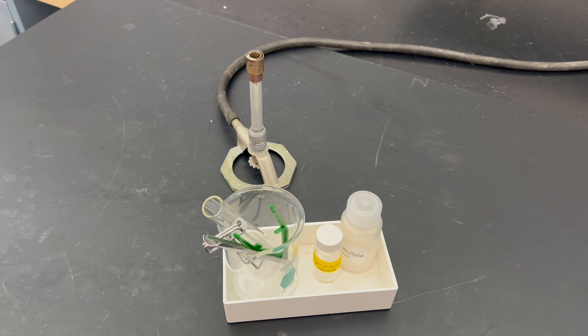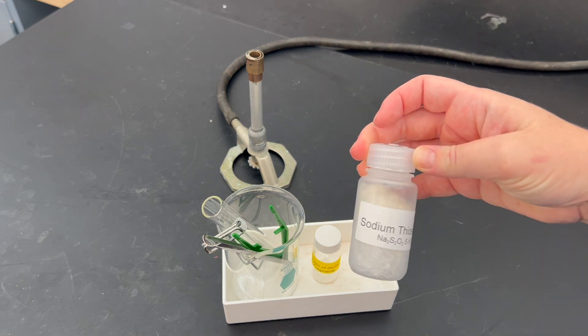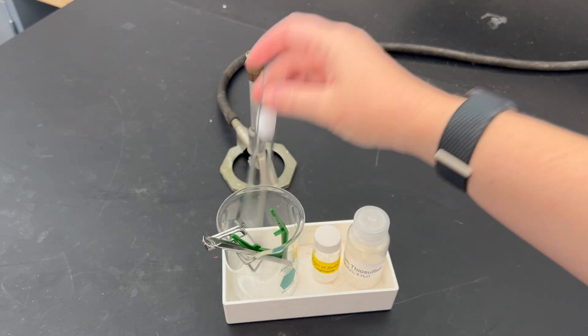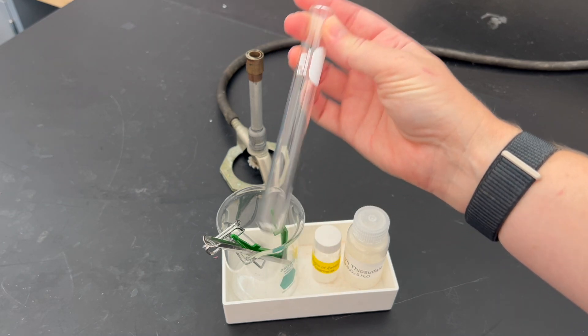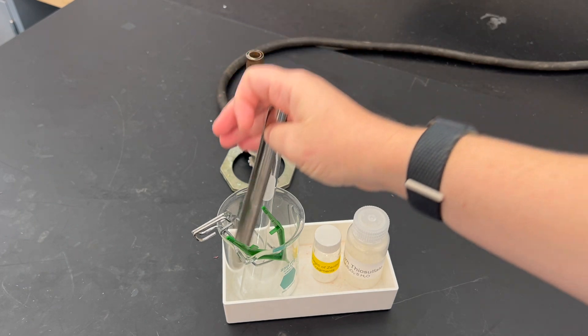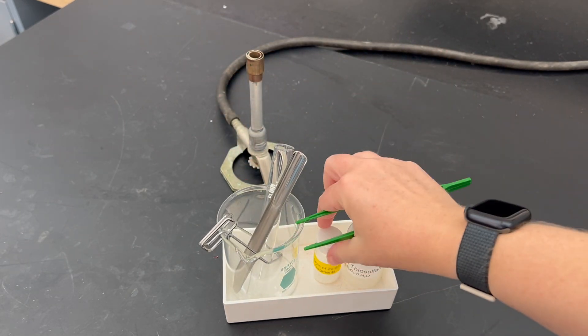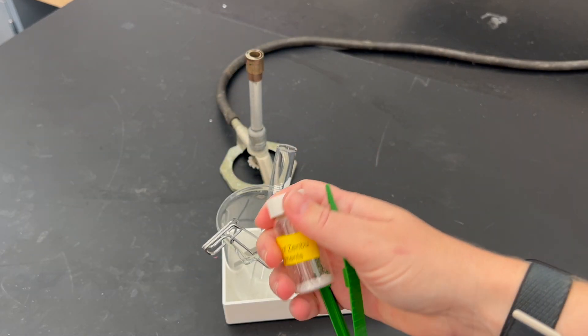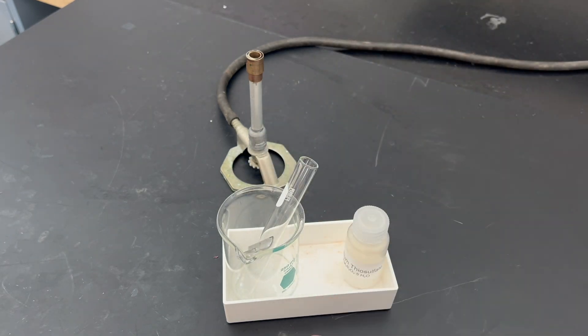Here's the kit you're going to need to do this lab today: sodium thiosulfate, a large non-disposable test tube, a metal scoop to get the salt out, some forceps, the magic of zenbu fragments (you won't need those till later), and some test tube clamps.